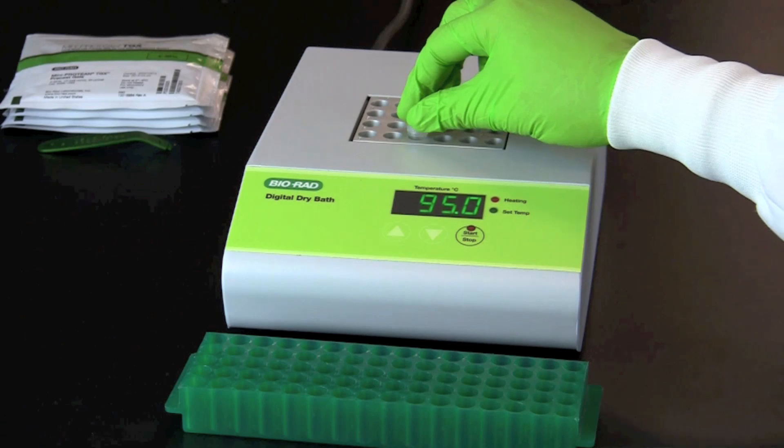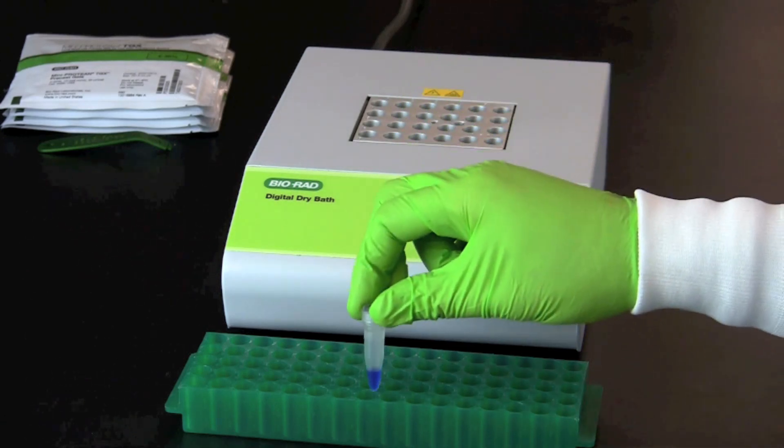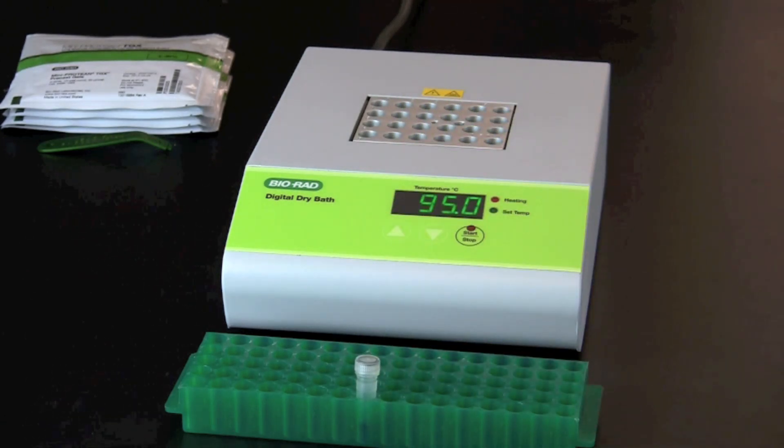This is a good stop point for this laboratory. You can proceed immediately to the next part of the lab, or store the protein extracts at minus 20 degrees Celsius for up to 6 months.